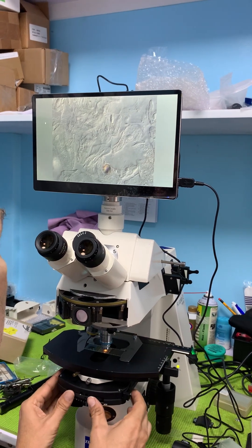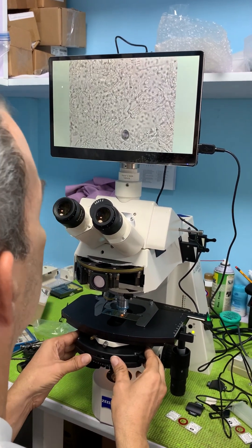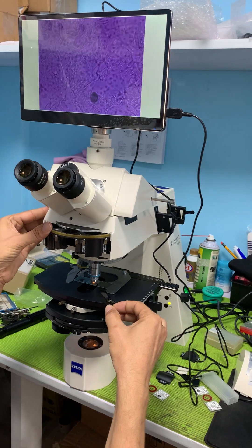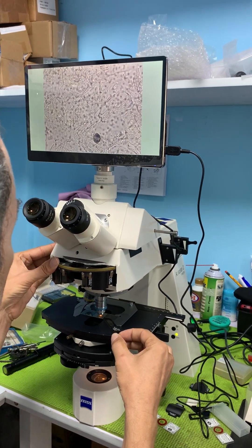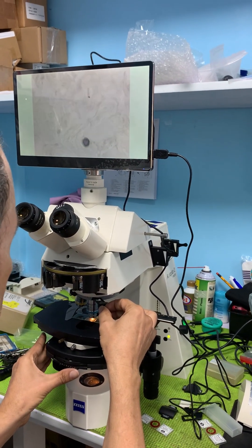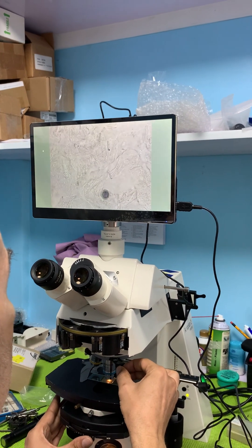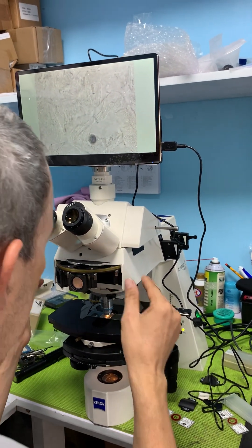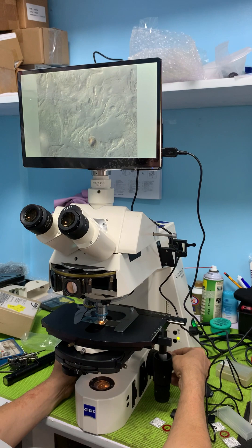I want to show you what bright field looks like. That's more of a bright field — you don't see the detail, just some contrasting because I've got the condenser turned down. If I turn the condenser to a normal setting, that's what you get. Now turning back — okay, we're back to our DIC.